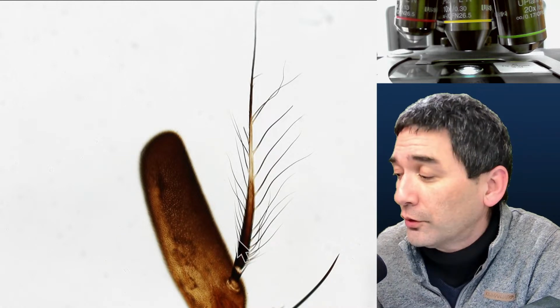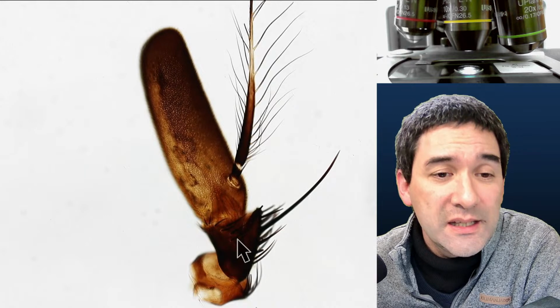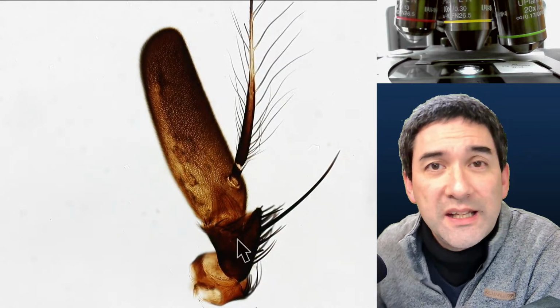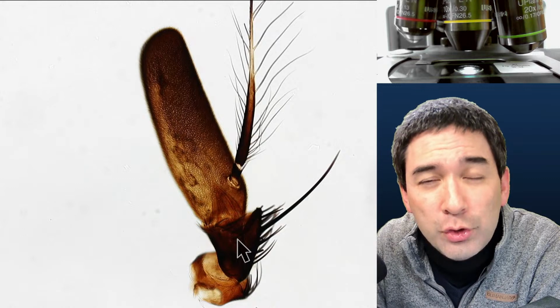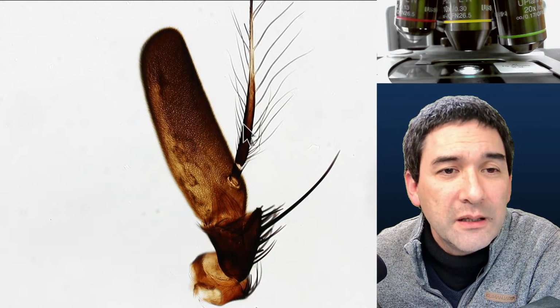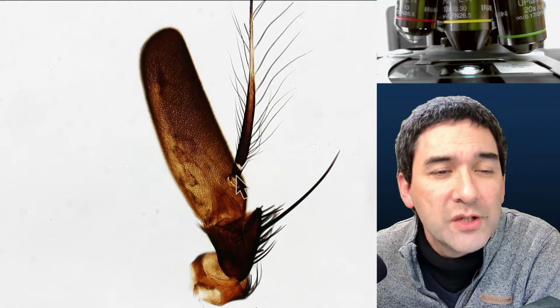So it's important for reproduction. And what I read somewhere is that in some insects, those antennae are so sensitive that they're even able to pick up individual molecules of those chemicals. So this kind of explains a little bit here. I guess maybe it's similar with flies as well.